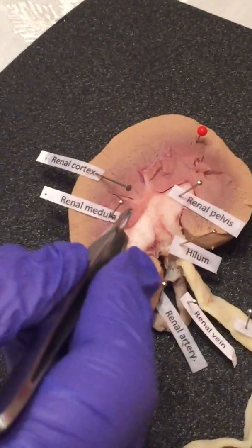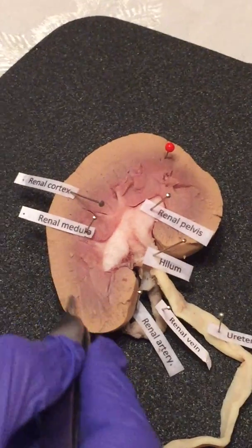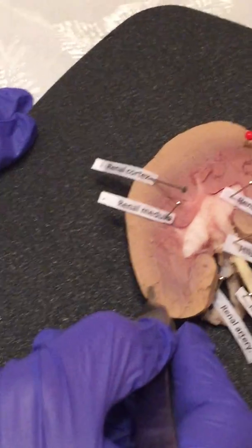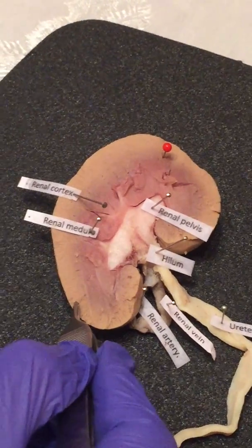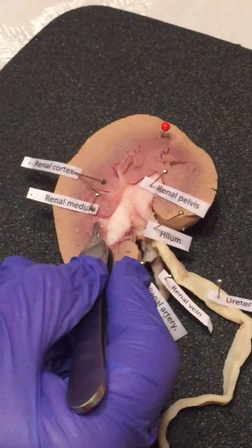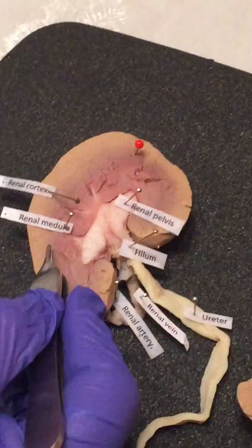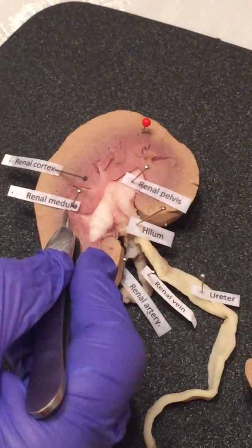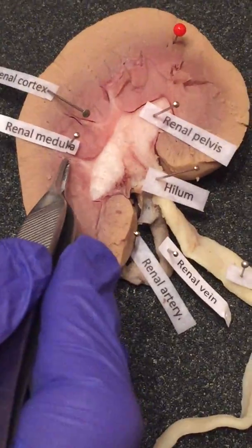And like we said earlier, this is the renal cortex, the superficial outermost portion of the kidney, and it allows for ultrafiltration. Then we have the medulla, which we talked about earlier, and this has the renal pyramids inside. You can't really see them, but they have the collecting tubules for the urine.